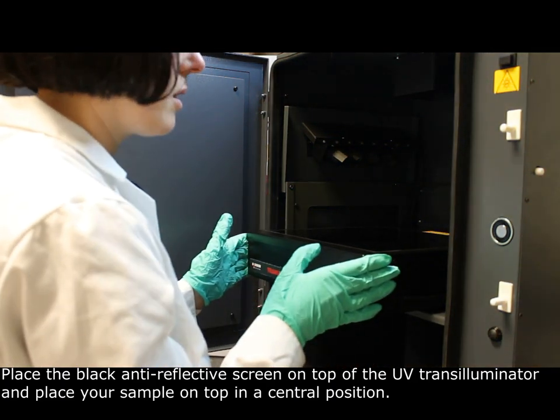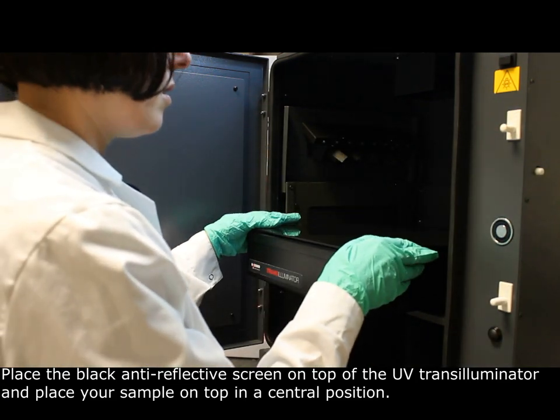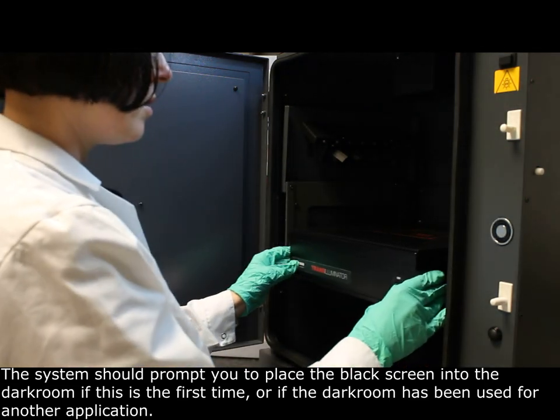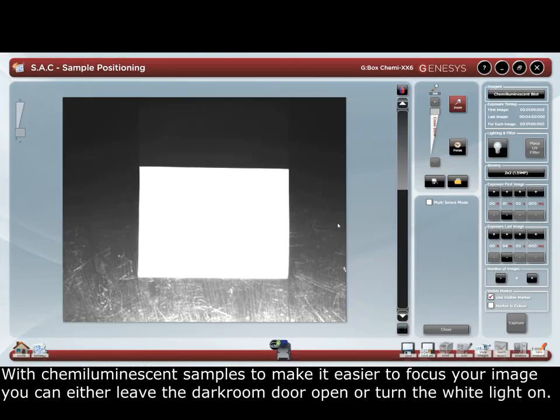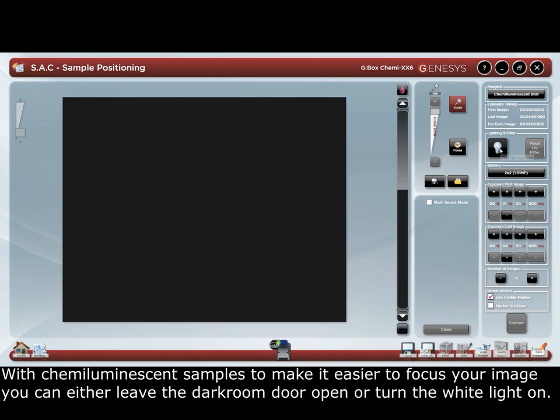Place the black anti-reflective screen on top of the UV transilluminator and place your sample on top in a central position. The system should prompt you to place the black screen into the darkroom if this is the first time or if the darkroom has been used for another application. With chemiluminescent samples, to make it easier to focus your image, you can either leave the darkroom door open or turn the white light on.